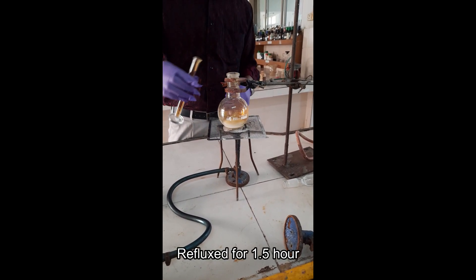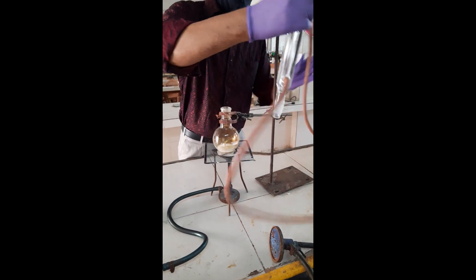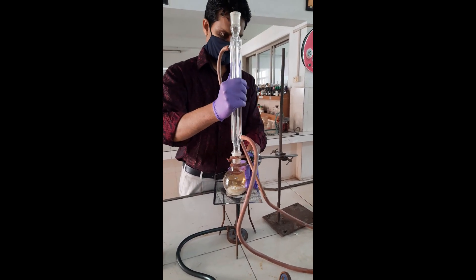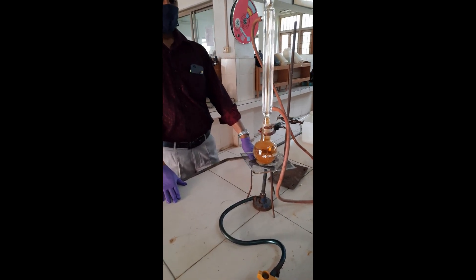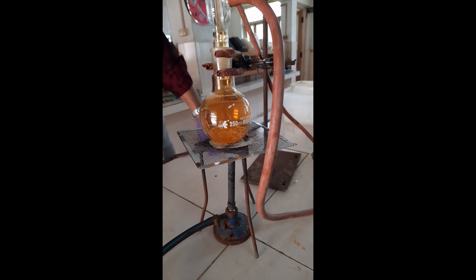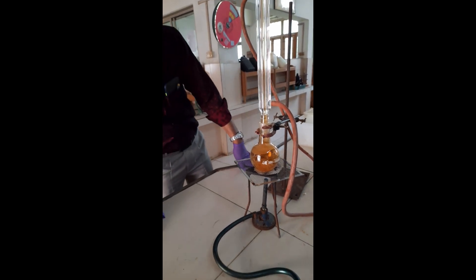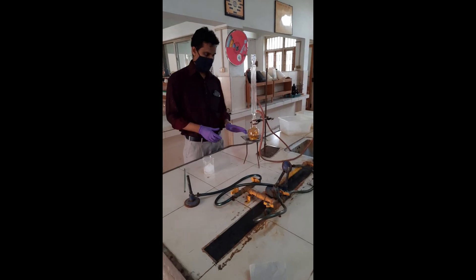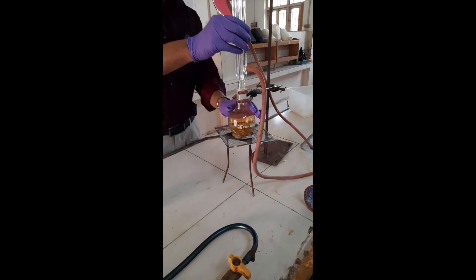Let it reflux for one and a half hours, until the reflux time is complete.